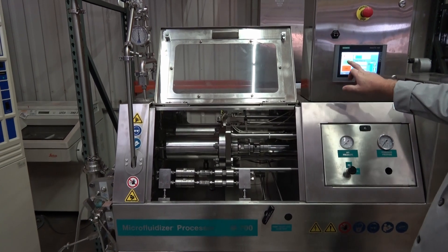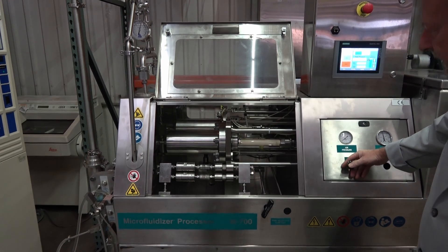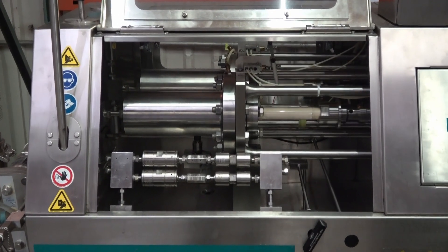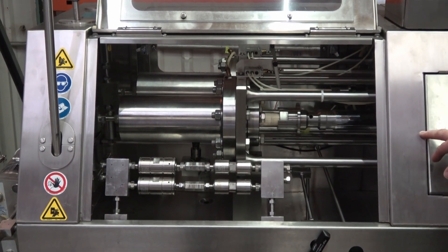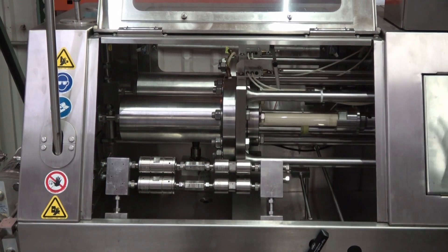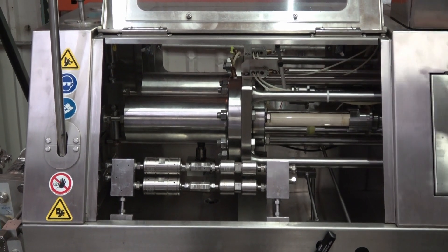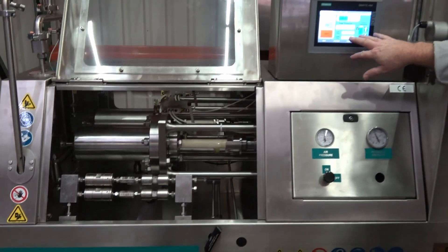We'll go ahead and start the motor — it gets a little noisier. You can see our two cylinders here; we're going to activate those now and fire them up. They work simultaneously so we can keep a very consistent pressure and consistent flow. While one cylinder is pushing fluid, the other one is getting ready to take over, and while that one is pushing, the other is retracting.